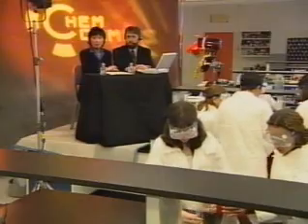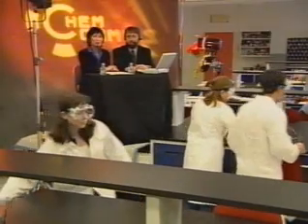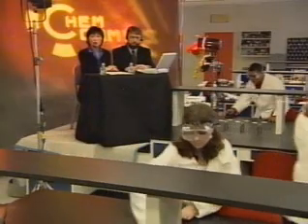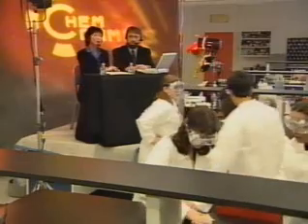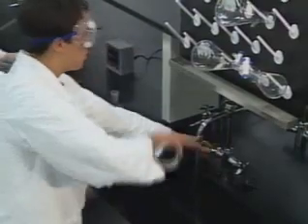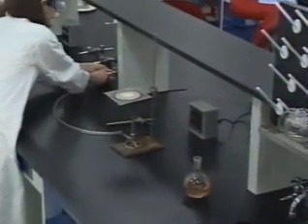Well, the experiments seem to be coming to their conclusions with a few minutes to spare, Adam. Roosevelt seems to be in a good position to take over the Chem Games lead. Will our competitors be content to just run out the clock? No way, Mia. There's still plenty of work to be done, and the judges will be watching it carefully. They still need to properly dispose of the chemicals, clean all of the glassware, and put all of the equipment away. Finally, it is crucial that they wash their hands.